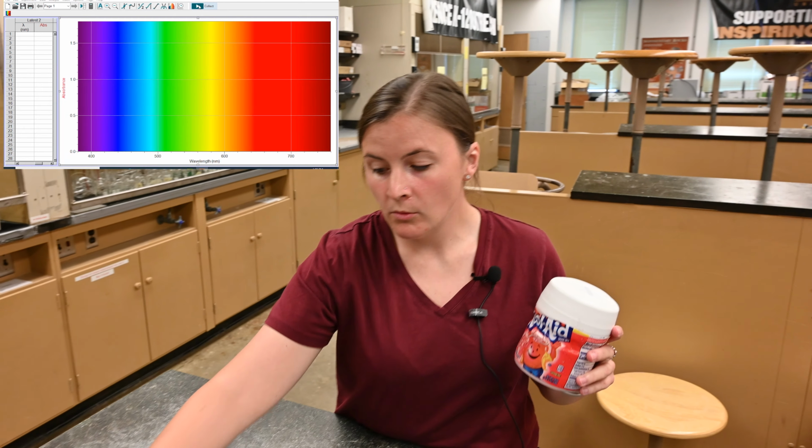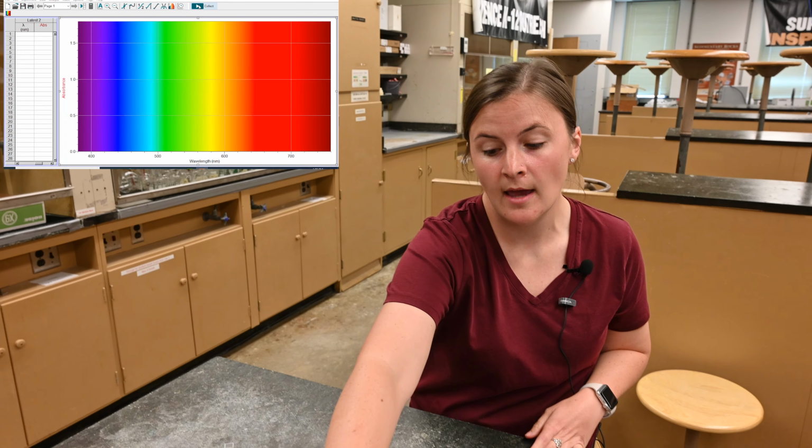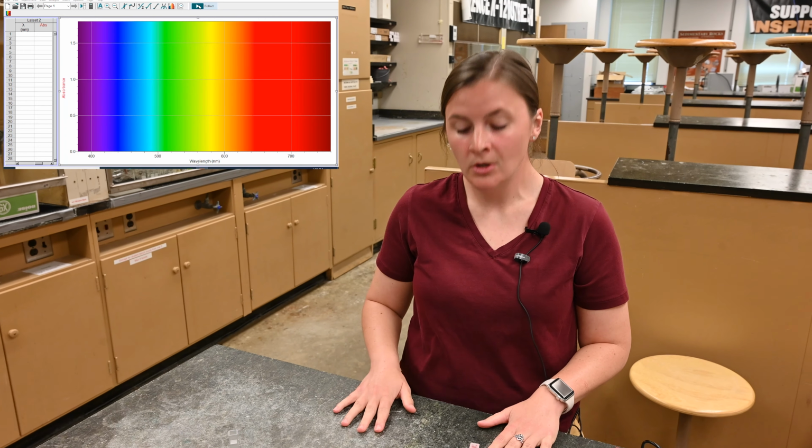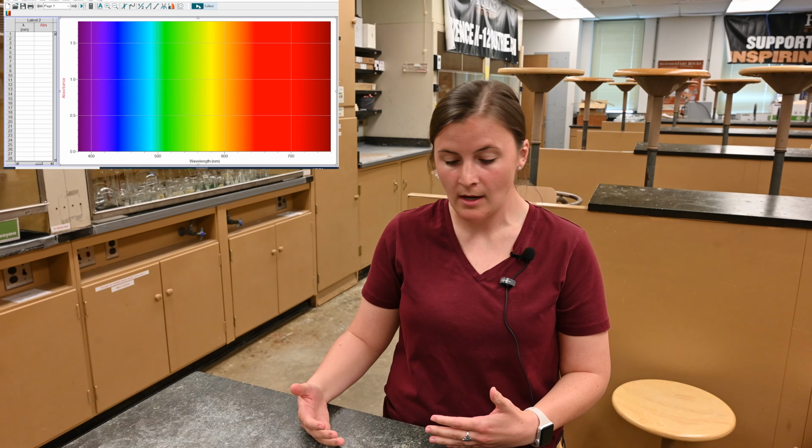So when we are doing the analysis of this, we are going to use absorption spectra to tell us how much light is getting through our sample. So this connects to our idea of our absorbance versus our transmittance, and that connects to how we see colors and what light passes through them.